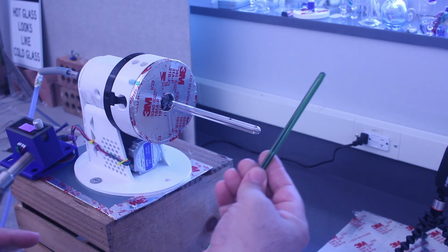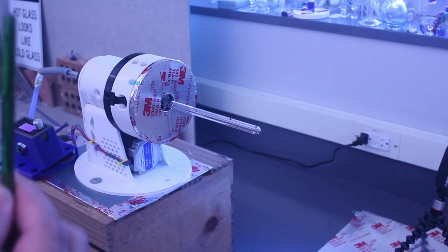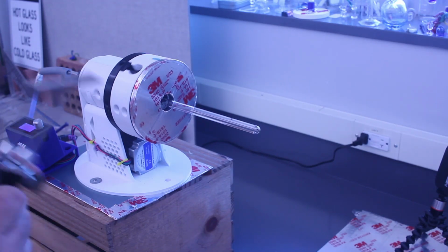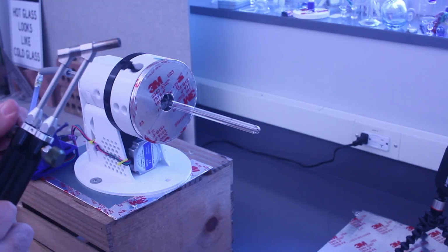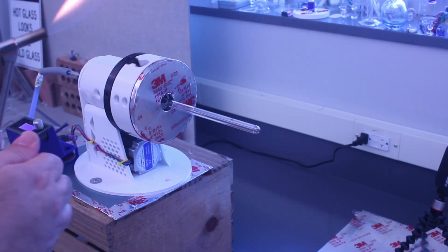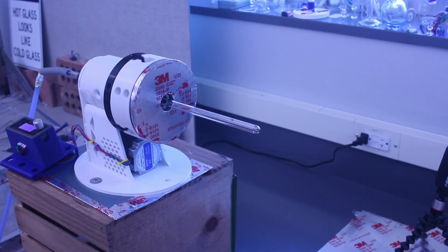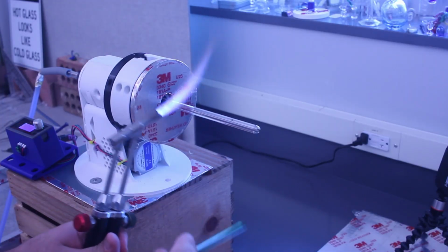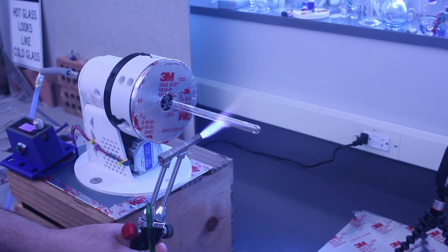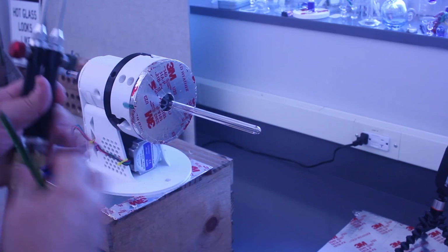Now, one of the things I'm going to do is, this is actually too long. And I'll fire cut it once I've reached that stage, but I don't want to do that right now. So let me get started. And I'm intentionally using a long piece of rod, but I'll be able to cut it down to size when I need to. So right now I'm just warming up the tube, and I'm happy with that. So I'm just going to stop, get my blow hose.